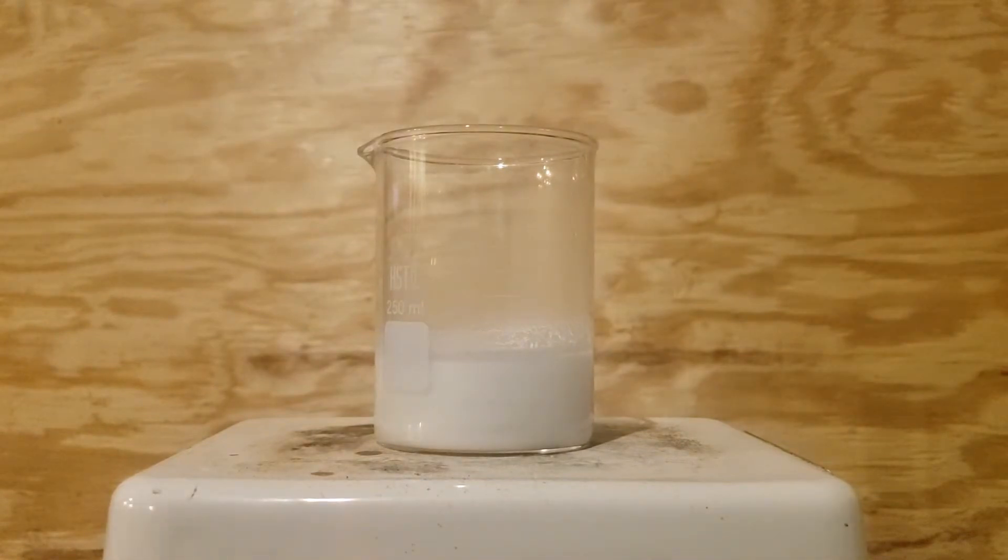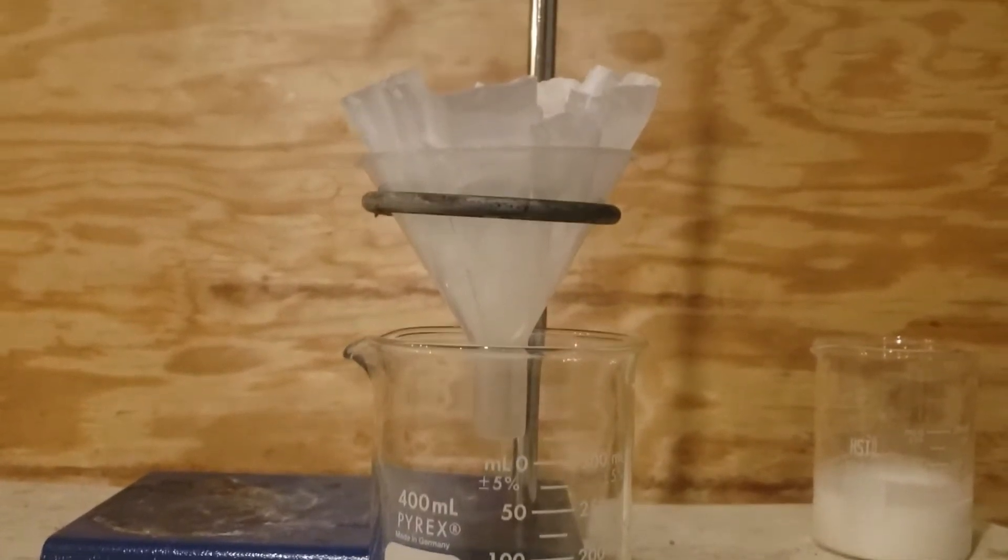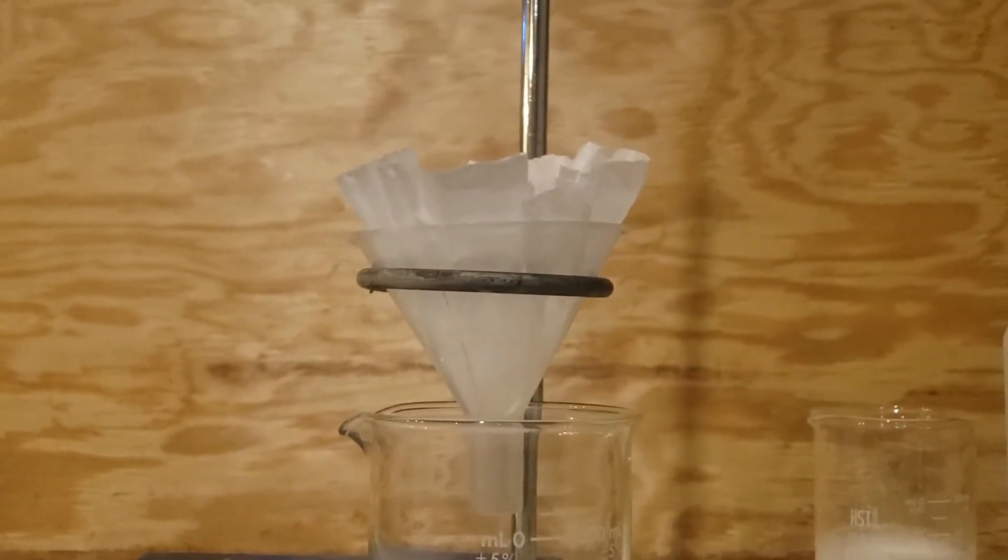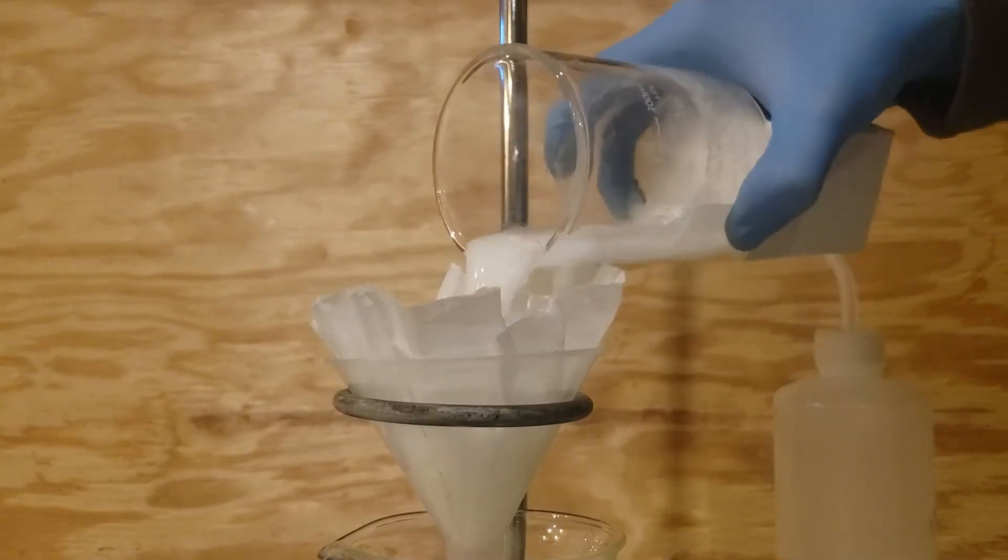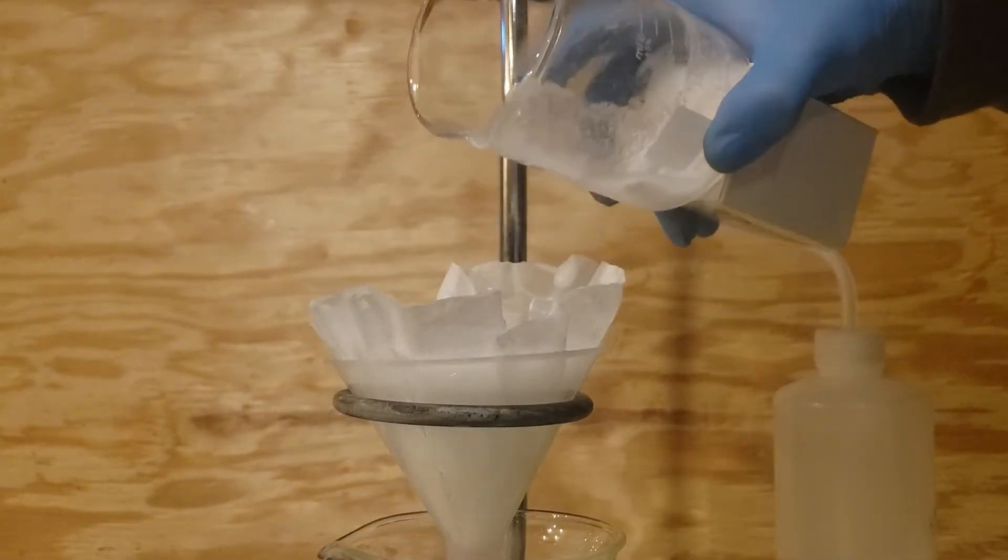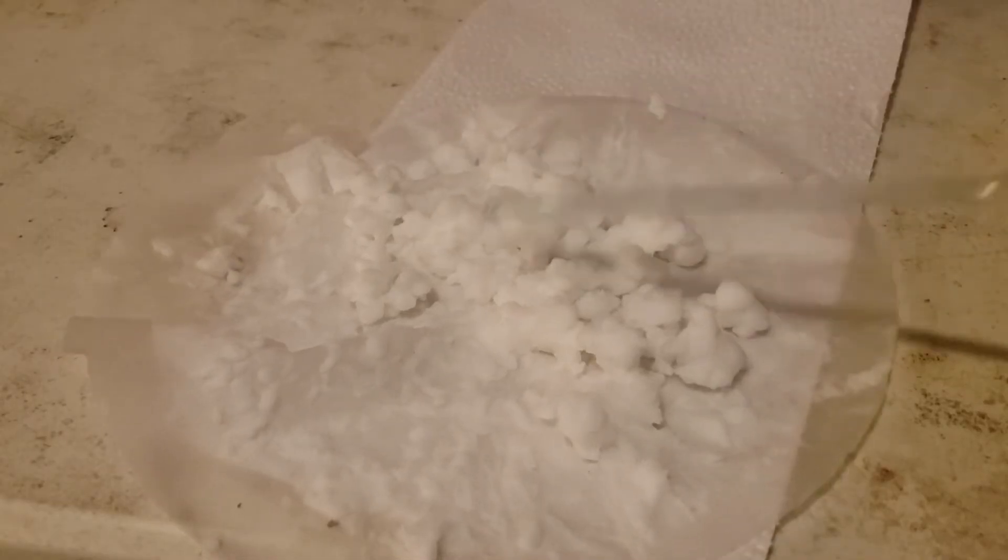I was originally going to scrap this video and just upload the next thing that works out. However, everything else in this video was correct, so I figured I would instead upload this video to show you guys the procedure of it.